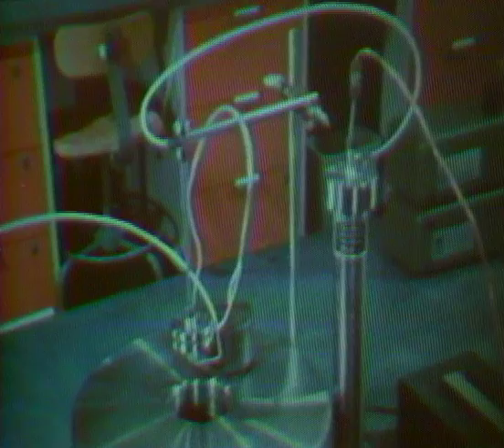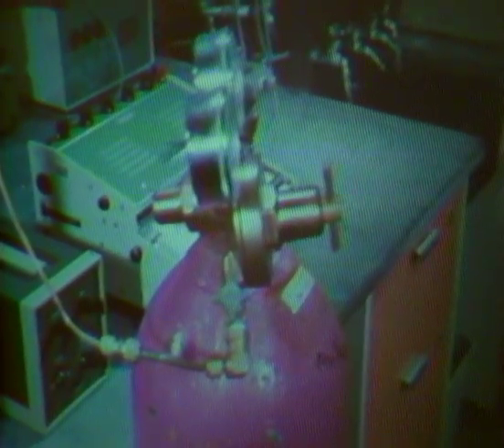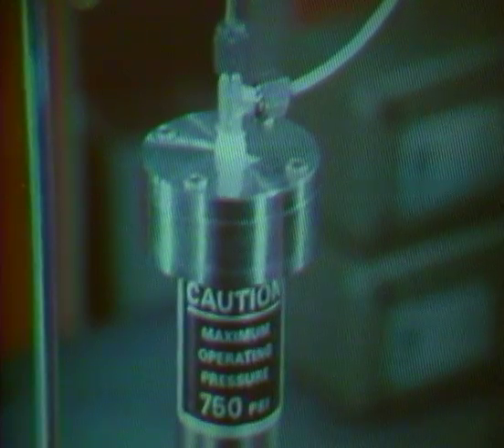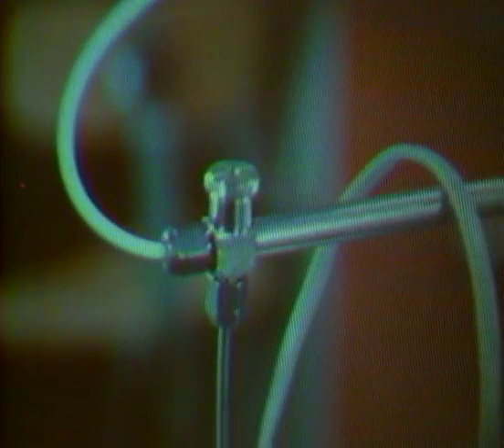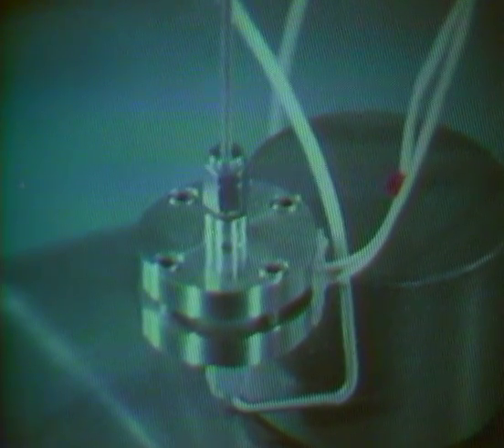The systems used in liquid chromatography are similar to those in gas chromatography. A reservoir contains the liquid phase. It is forced through the column by high-pressure gas or by pumping. From the reservoir, the mobile phase moves to the injector port, where the sample is injected by syringe. Separation occurs in the column, and the detector measures the concentration of each component of the sample.